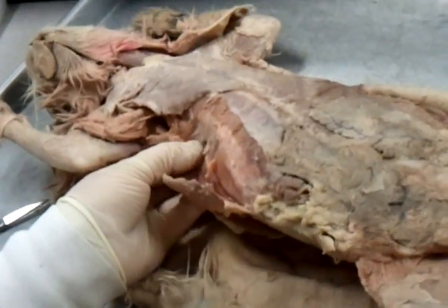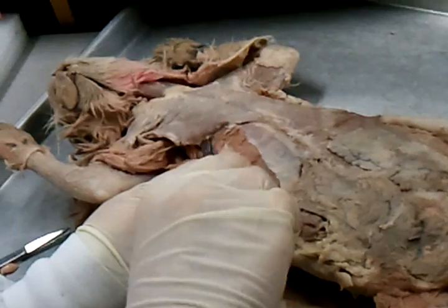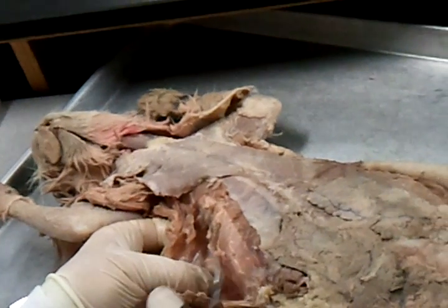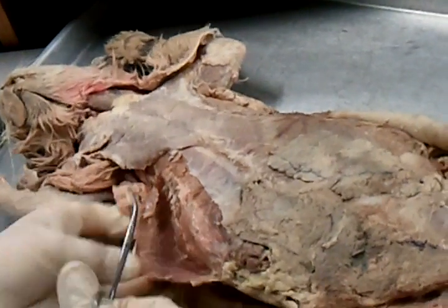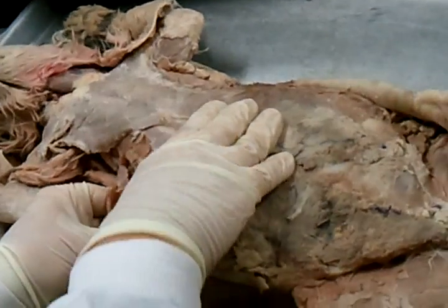She still has babies in there? Yeah, we'll get in there later. You can see babies — we have babies on the preserve. Jorge's name is... you guys want to name the kittens now? It's like a five-for-one — a female cat. You can't handle all the kittens. It was named Jorge — a female cat. That was before they knew how to sex.